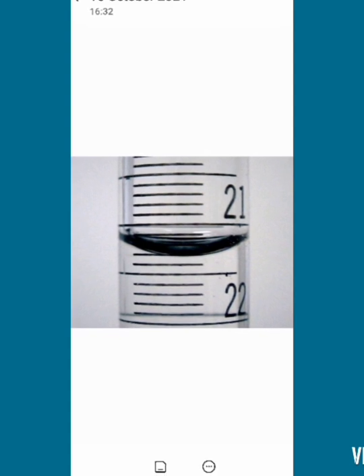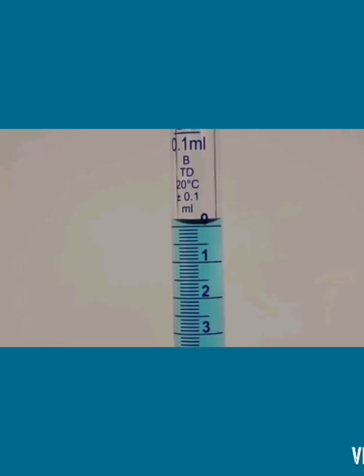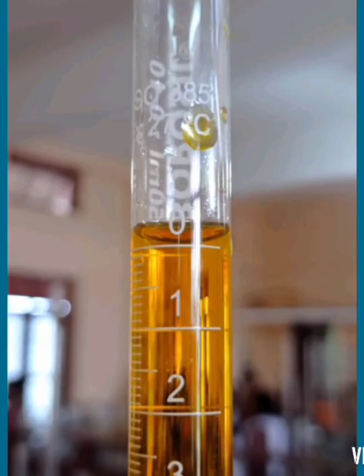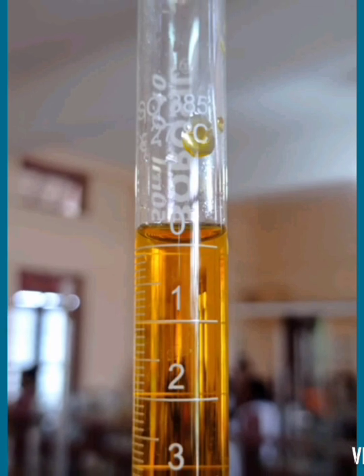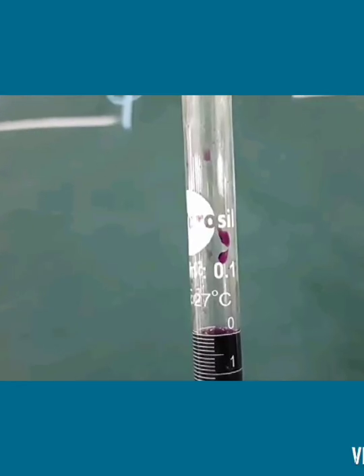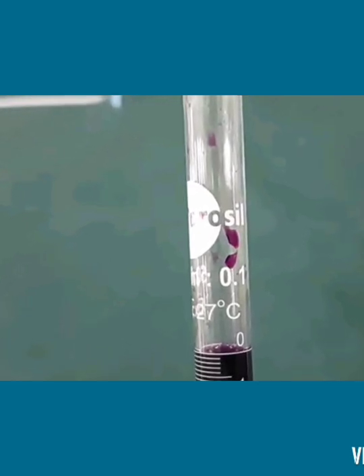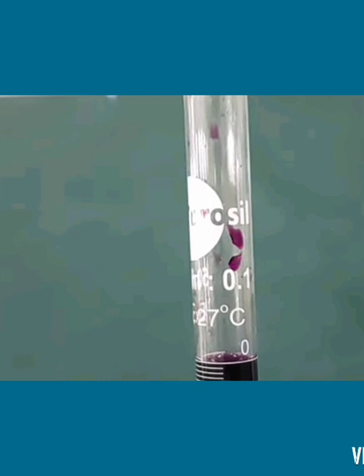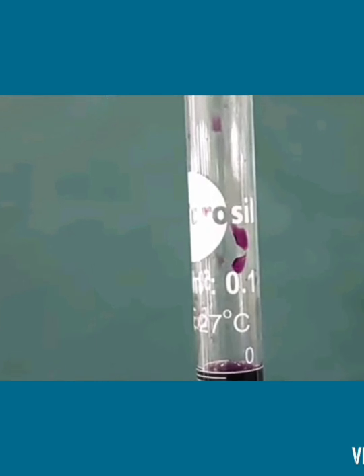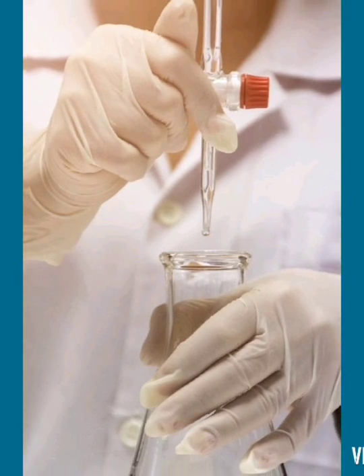The meniscus is the curved surface at the top of the liquid level. For colored and colorless solutions, if the lower meniscus is visible, you have to consider the lower meniscus itself. However, for solutions like permanganate, where the lower meniscus is not visible, we use the upper meniscus. Taking the difference between the initial and final volume will give the volume transferred into your receiving vessel.